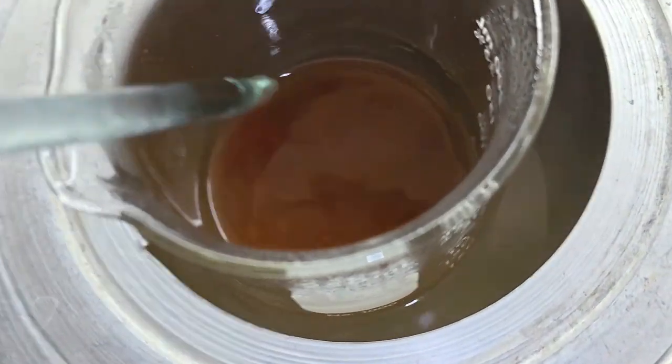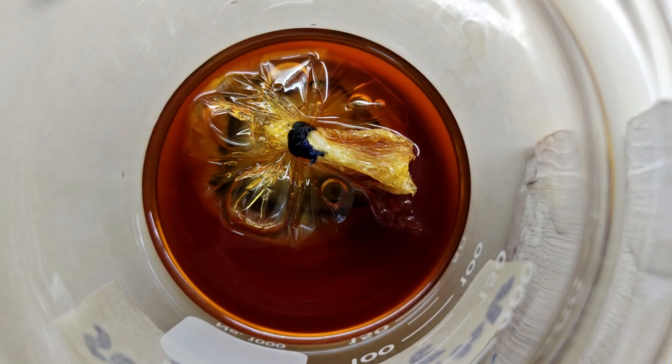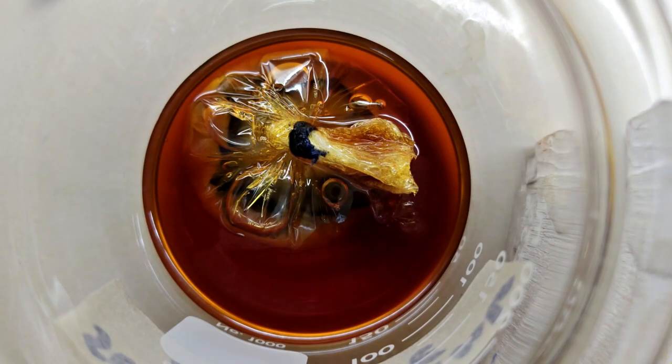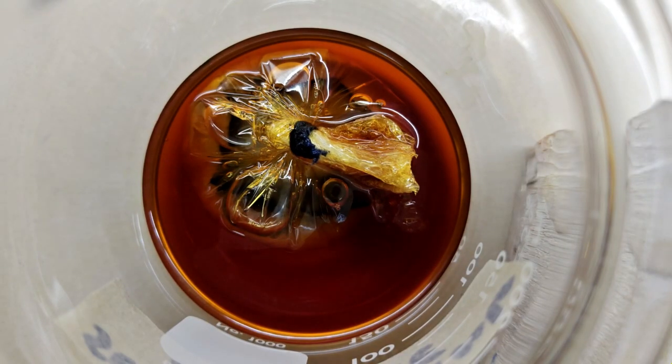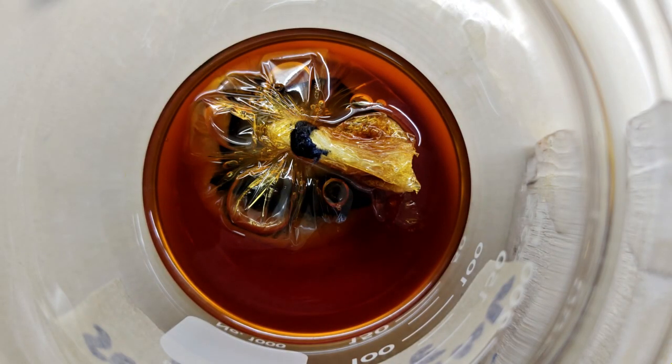In conclusion, the membrane transport model successfully demonstrated selective permeability and diffusion across a semi-permeable membrane. Iodine molecules crossed the membrane and reacted with starch, while glucose did not diffuse into the outside solution due to the limited permeability of the cling film membrane.